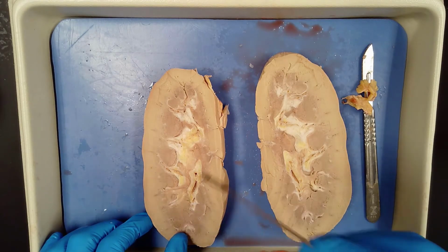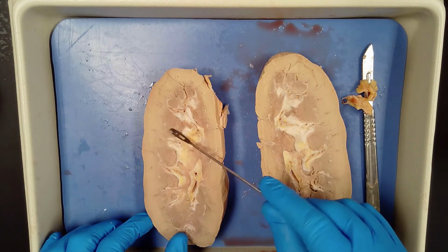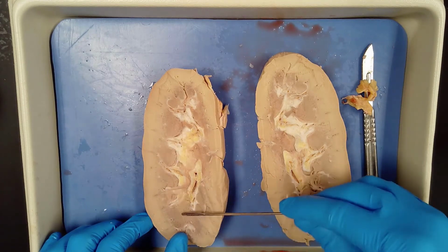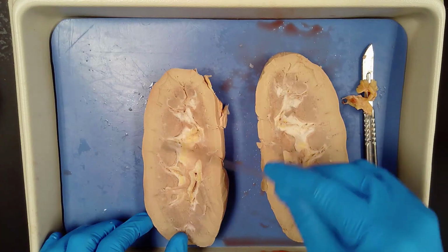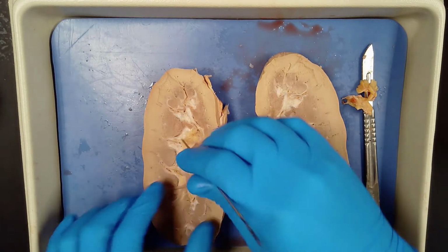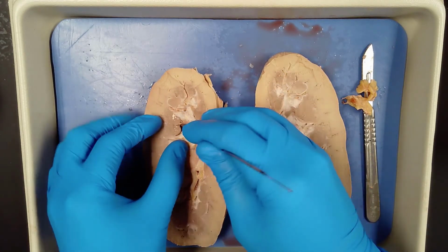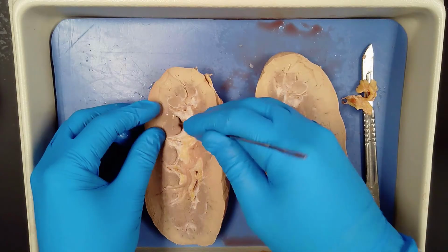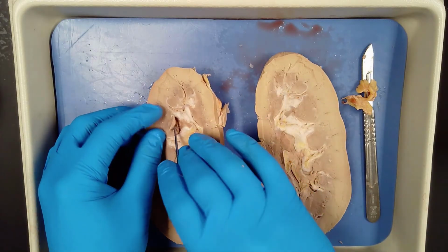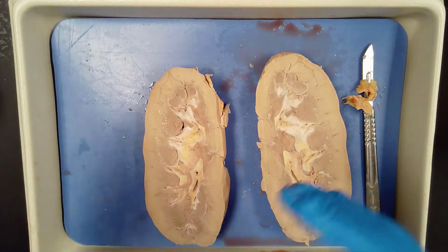And those are called the renal pyramids because you can see they kind of look like little pyramids right in here, right? So you can see that there. And they have collecting ducts. And these collecting ducts at the end of those, if I can kind of open this up just a little bit. Let's see if we can see that. You can see there's some collecting ducts in here. Whatever needs to be secreted out is collected into there.